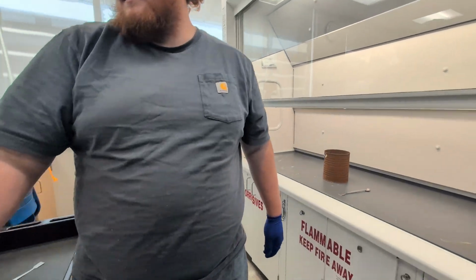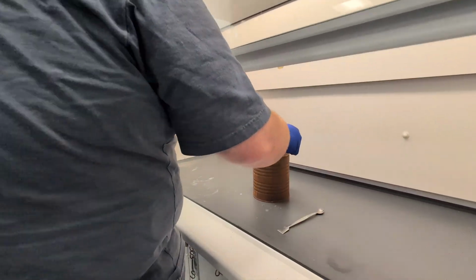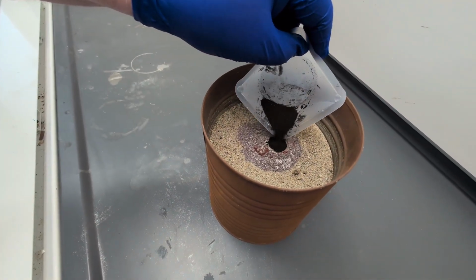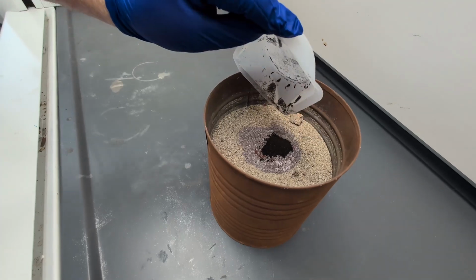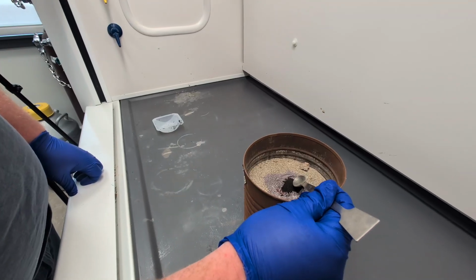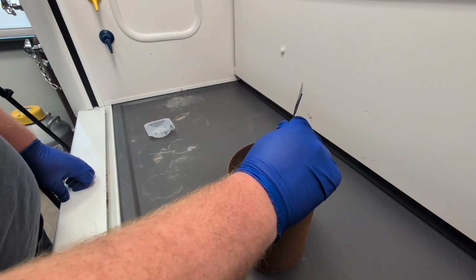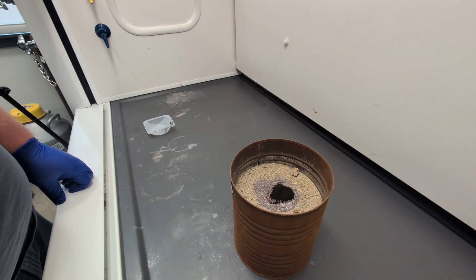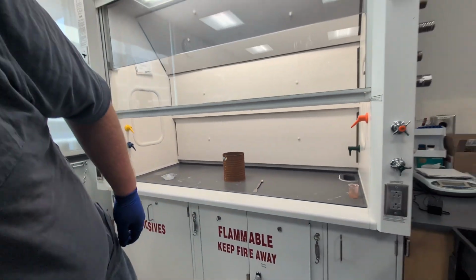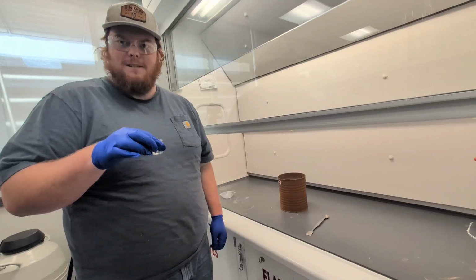And you said potassium permanganate, right? Yes. Okay. So now we'll put the glycerin in to start the reaction, but I want to switch to slow motion real quick.